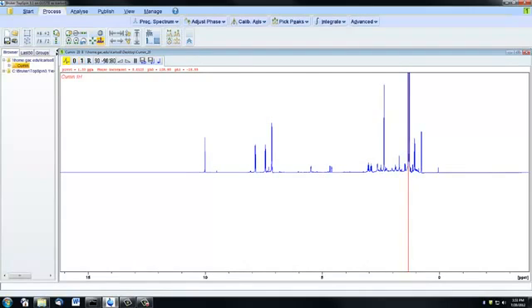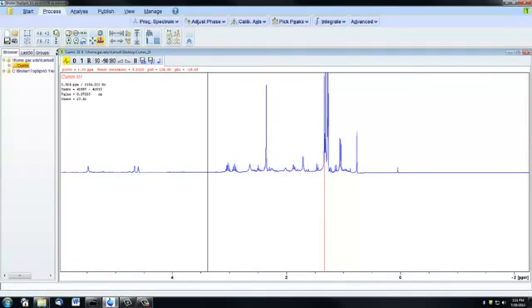So it can be helpful to use the coarse adjustment first and then maybe zoom in. So here I can show you if I zoom in on this part of the spectrum, maybe do some coarse adjustment first, and then when it looks pretty good to me, I might switch to a finer adjustment and just try to really make small little changes in the zoomed in version.